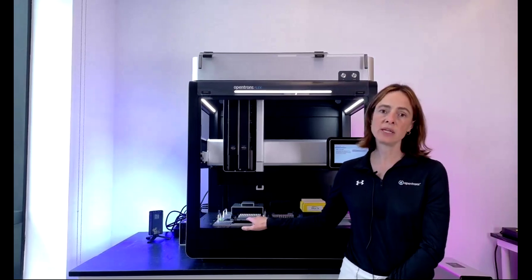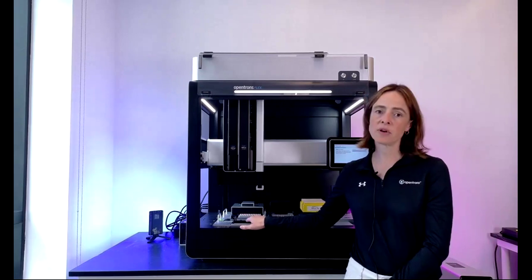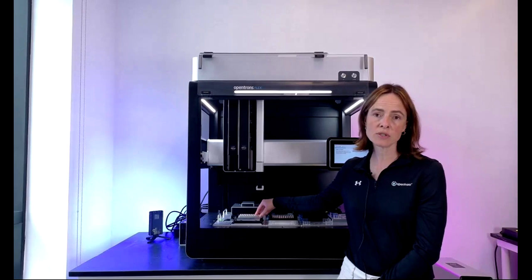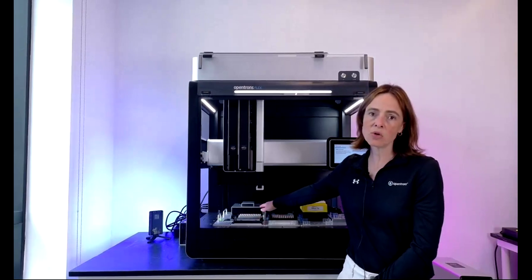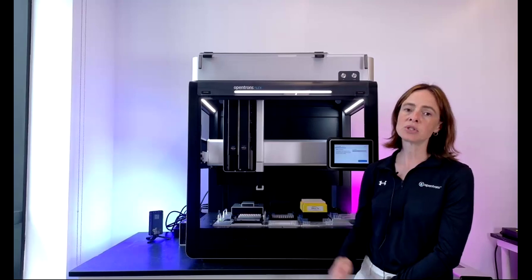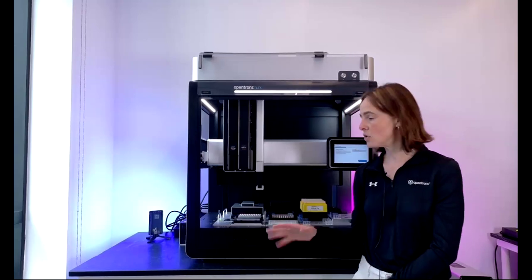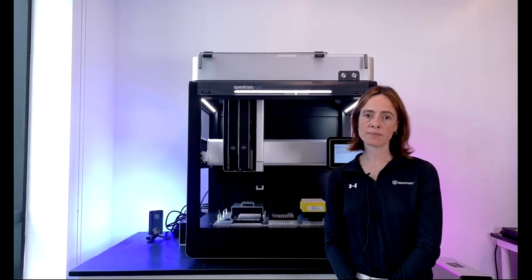Over here, we have a heater shaker, which can shake from 200 to 3000 RPM and heat to 95 degrees C. Behind it, a temperature module, which can go from 4 to 95 degrees C. And at the back, you can just see the lid here, is the Opentrons thermocycler, which can automatically open and close using the software. And so it's a really unique option for automating PCR and other workflows.